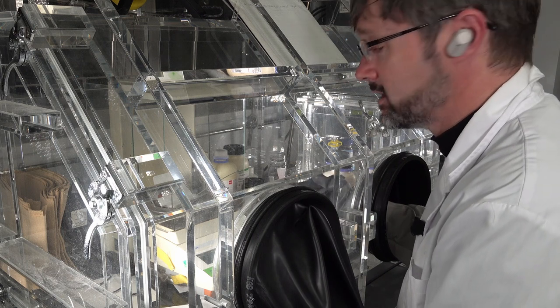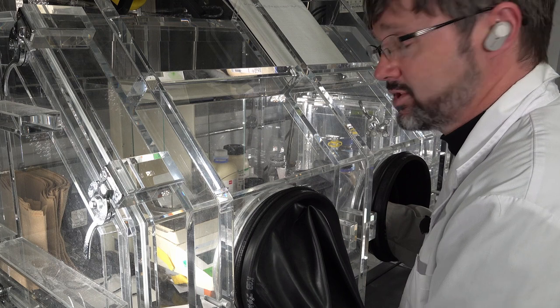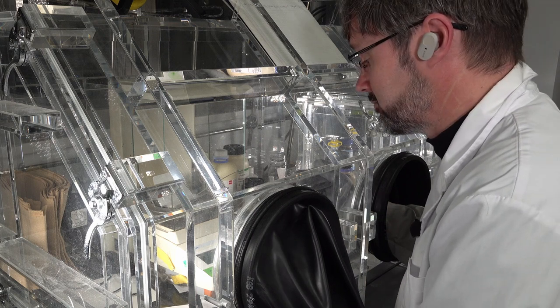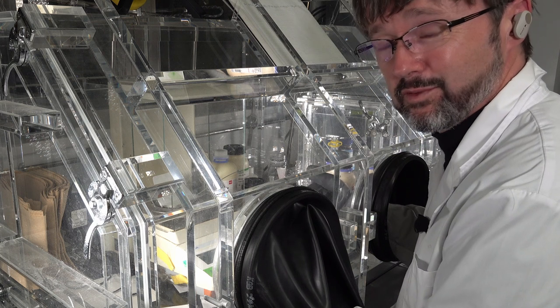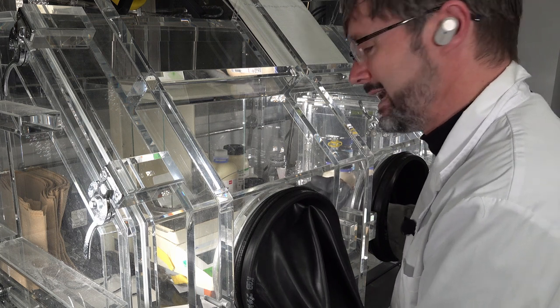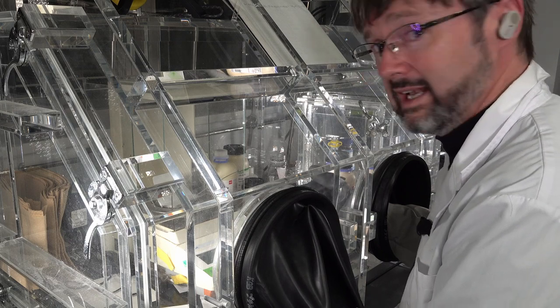Now if I'm being very careful with my measurements, what I'll do now is measure the weighing paper after I've added the material to the flask and see what it says, and just check that everything has gone in. And I've got perfect zeros now. So yeah, everything went in. That went okay.